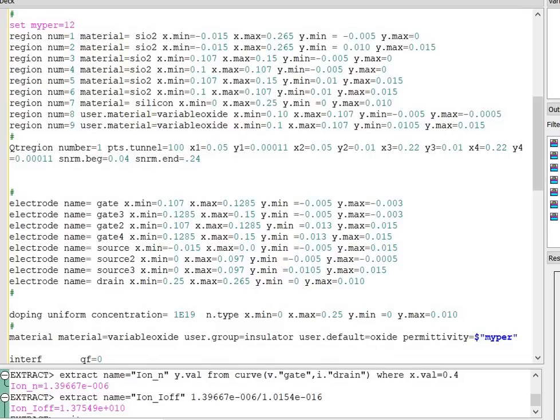Before moving to the region and material statements, first I have defined the permittivity of the proposed material. I have set the permittivity to 12 in the case of the junction-less TFET biosensor. First region, having the material SiO2 with different positional parameters. Regions 2, 3, 4, 5, 6: all materials have the same oxide layer SiO2. Region number 7 has material silicon. Region number 8 has the proposed material, user.material, with the name variable oxide and its positional parameters. And region number 9 is again the proposed material with the name variable oxide.